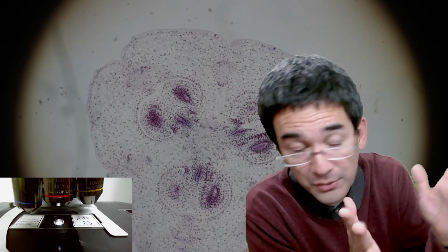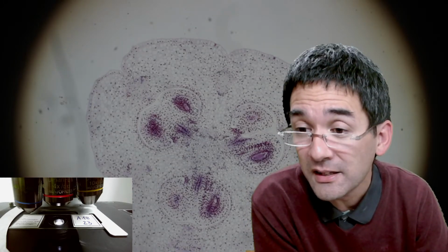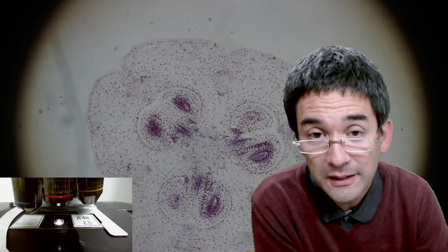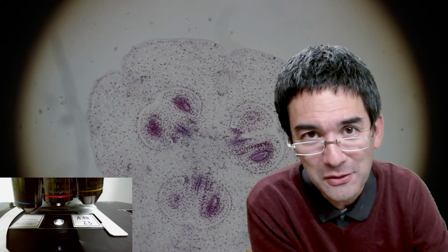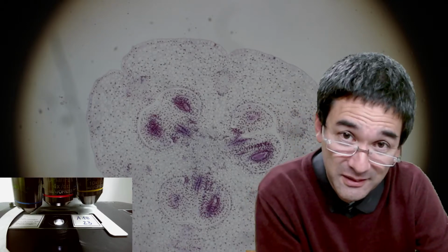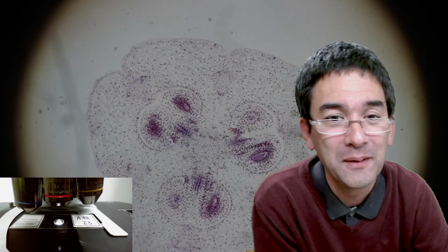Yeah, I would guess this is a hypothesis right now. So the answer to your question, if it's made of the same material, is yeah, generally yes, but if you go into details, no. Different biological membranes are made of different phospholipids and proteins, but the class or the category is the same. Yeah, so but actually I wanted to zoom in a little bit in the hope of finding something.